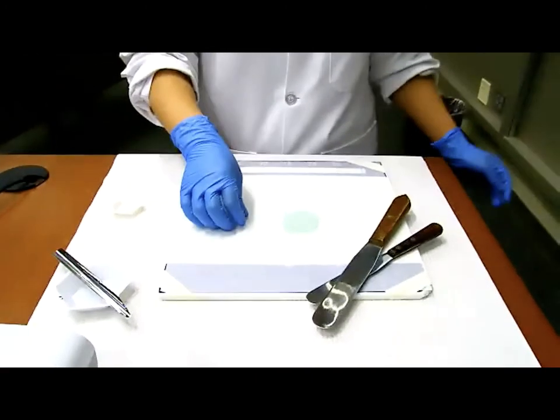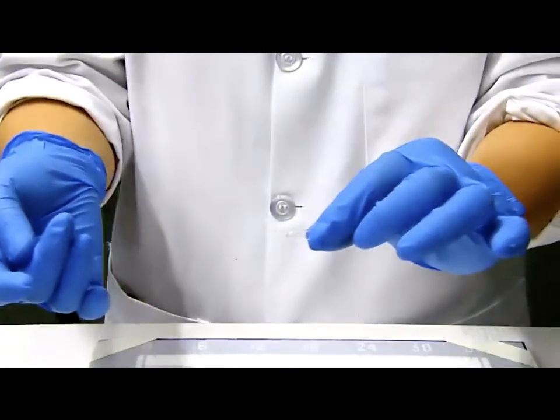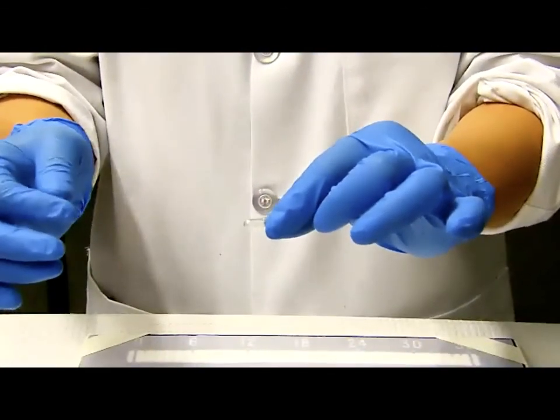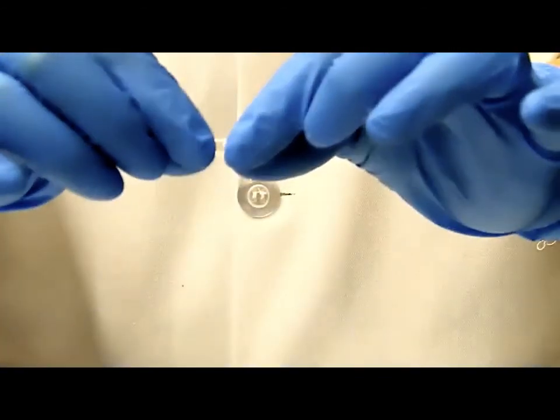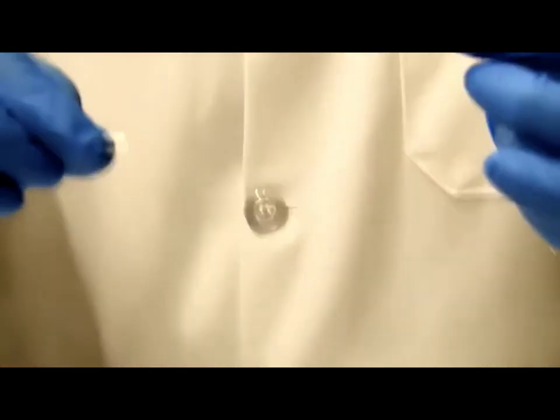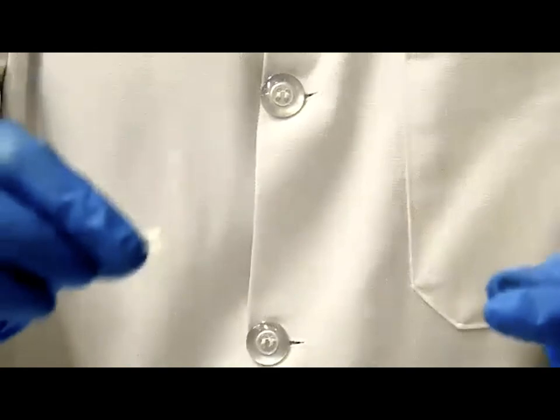Okay, one more time, your capsule shell has two parts, those commercial capsule shells. So you can easily take them apart. The short one is the head, the longer one is the body. We're going to use the body to do the punching method. So place the head somewhere on your bench.